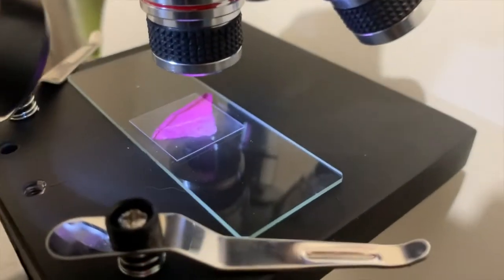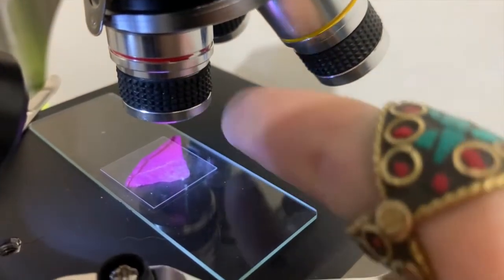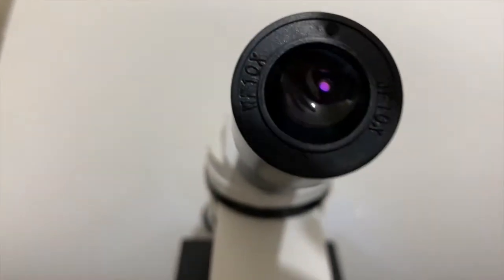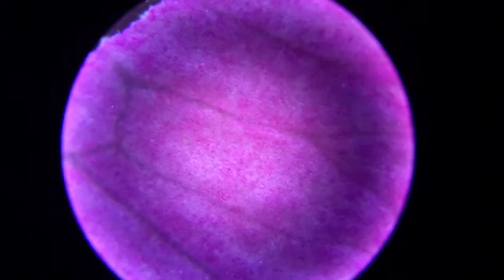Okay friends, so here we have our microscope. There's the rose petal under there. And we're gonna see how the image comes up this way, and we're gonna put our eyes up to here. So I've already set it up, and I'm gonna put my camera really close. And as you can see, let me get it there. Do you see those lines? Those are the capillaries. That's where we can see where the water goes in.